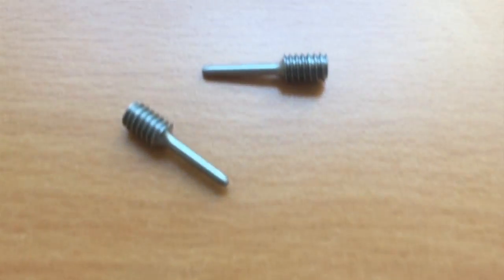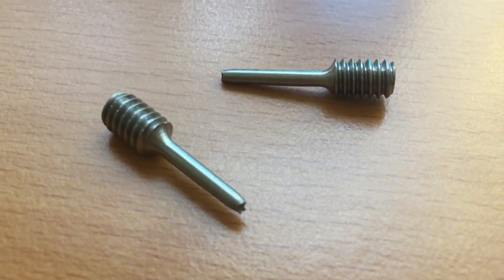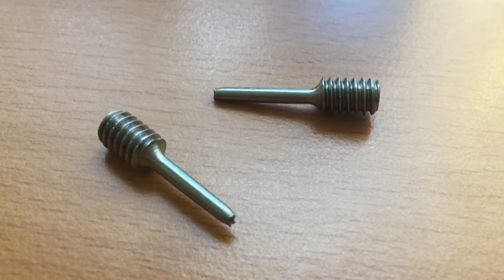After the sample is broken, remove it from the jaws of the machine and measure the final elongation by placing the two pieces back together and measuring the distance between the gauge marks.